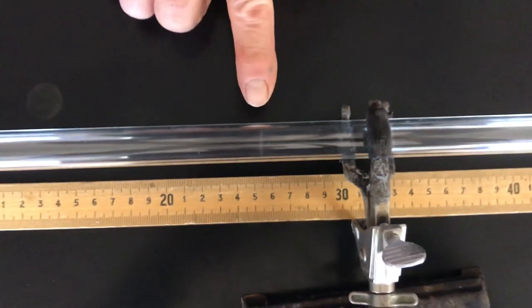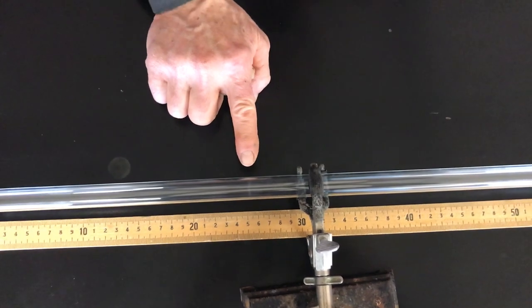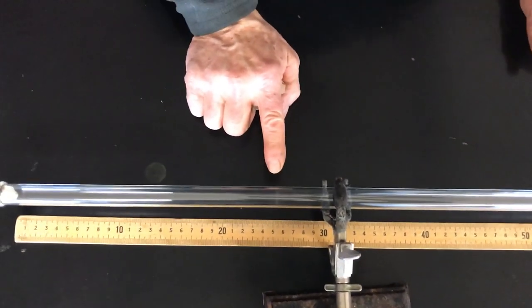So, yeah, there's our line. So, now what do we do? How can we show that this demonstrates Graham's Law?